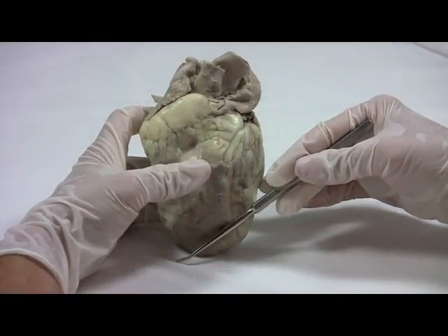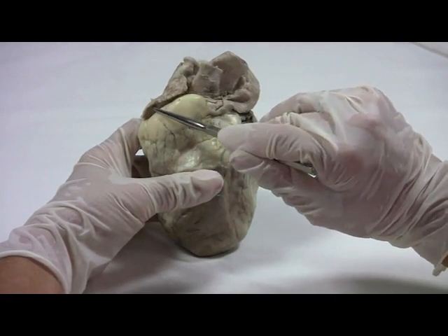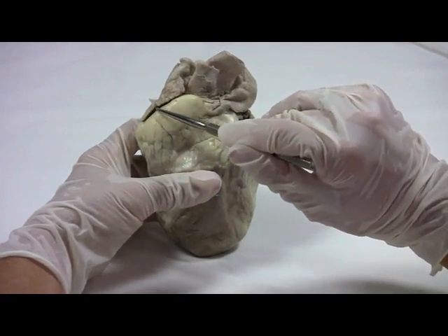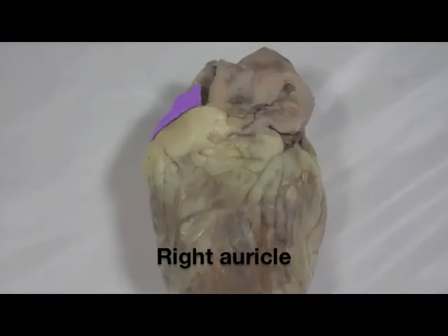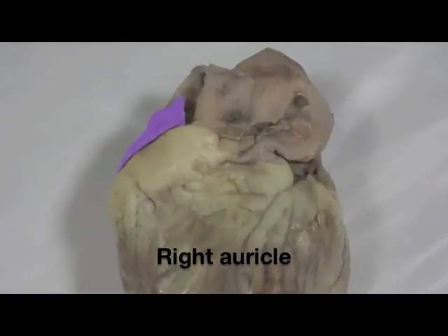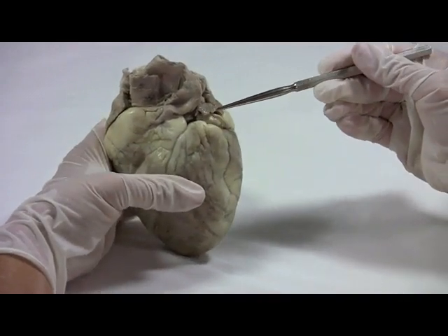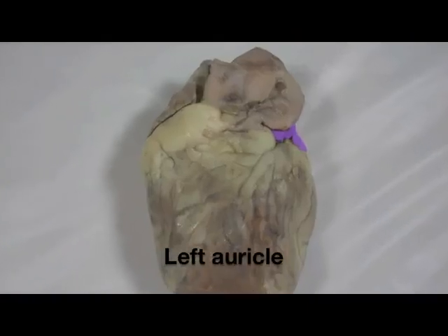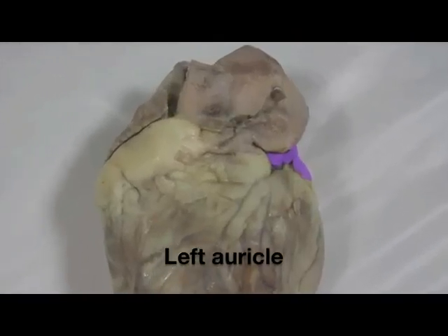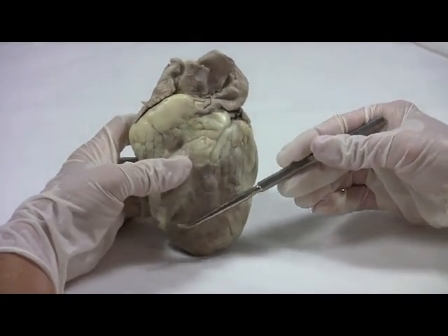We can see where the four chambers are located. This flap-like structure is the right auricle. It's a little flap-like extension that comes off of the right atrium. Here is the left auricle. The rest of this tissue makes up the ventricles.